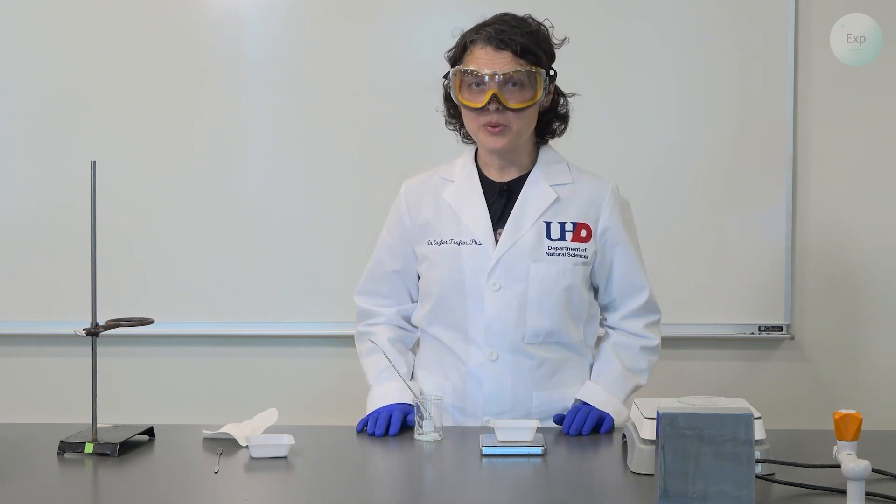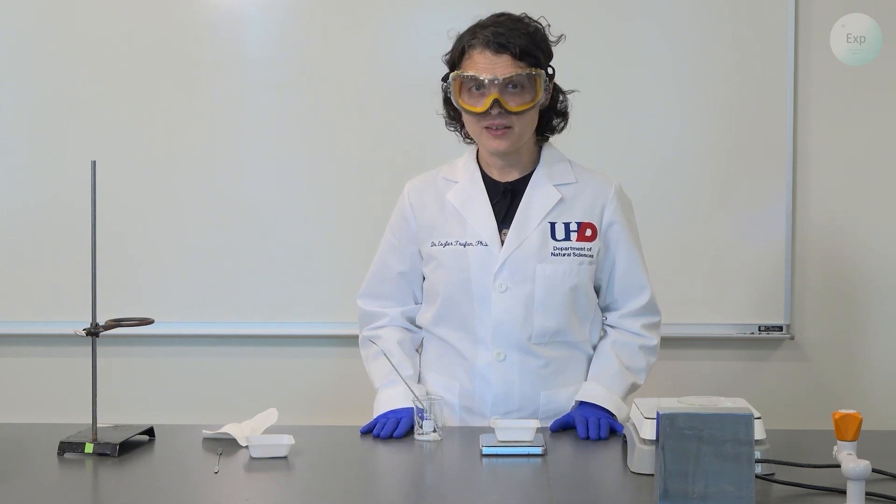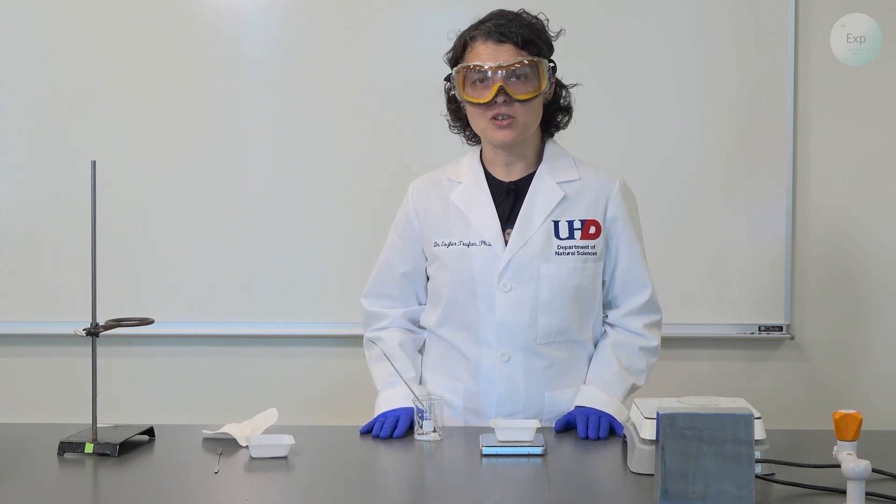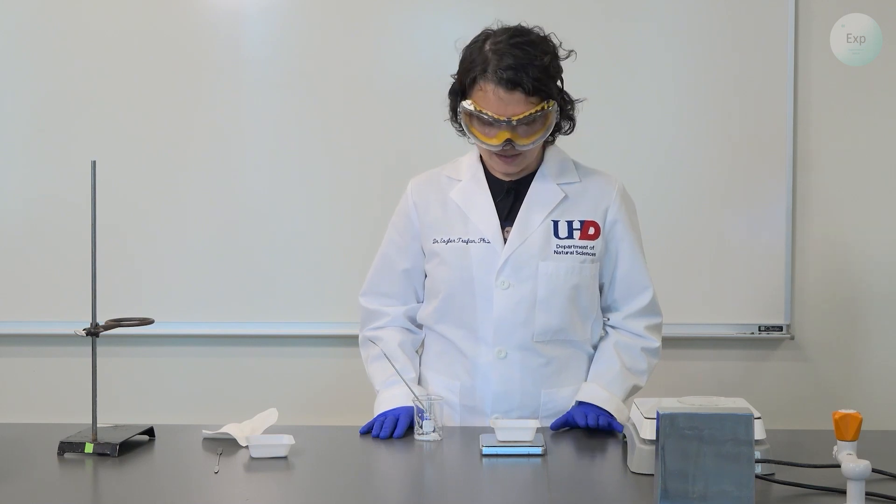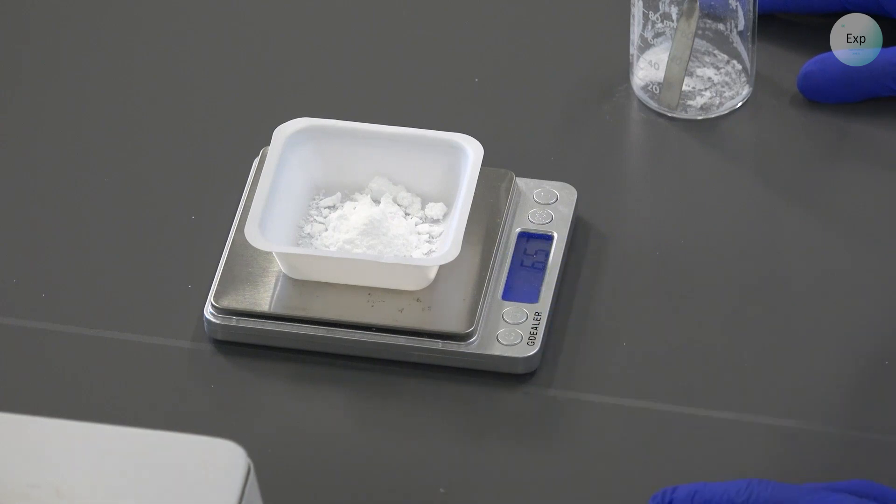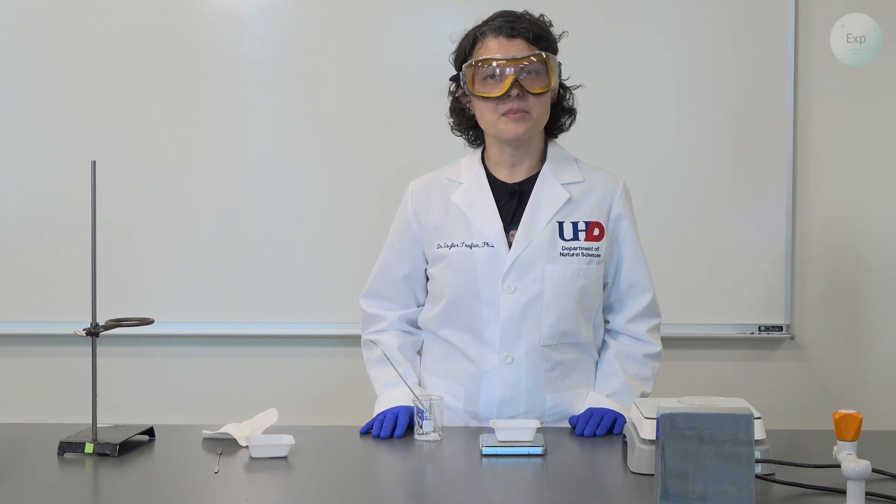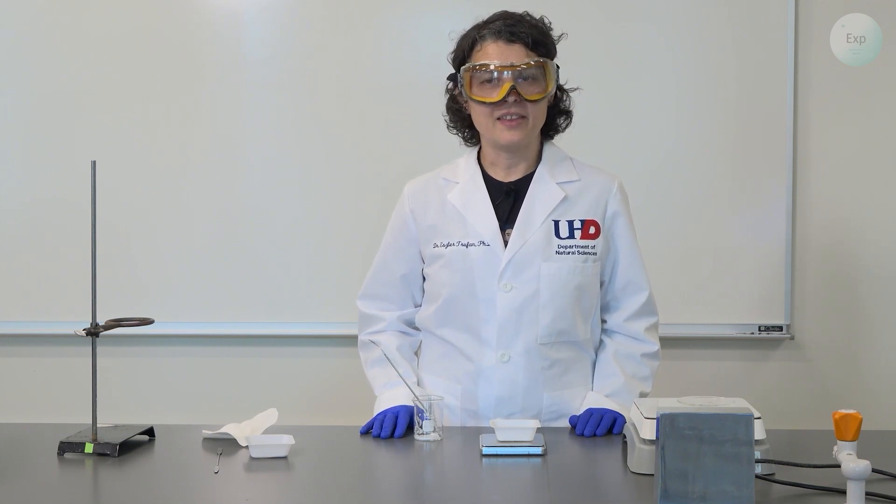It is important to put in some solid effort, but when you get really tired and you can't remove any more salt from the beaker unless you break it, it's best to stop. So at that point, you record the combined mass of your weighing boat with the salt, and in this case it is 6.57 grams. And you will say, this is as much as could be recovered using the methods and the techniques that you applied.